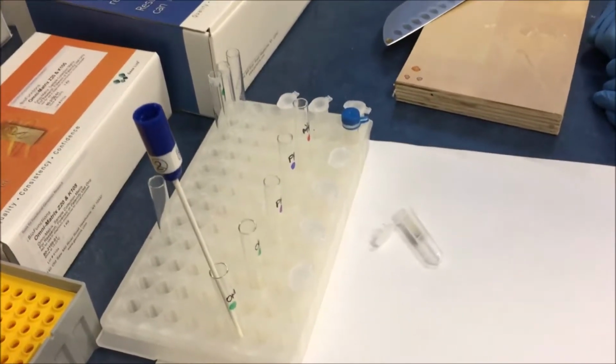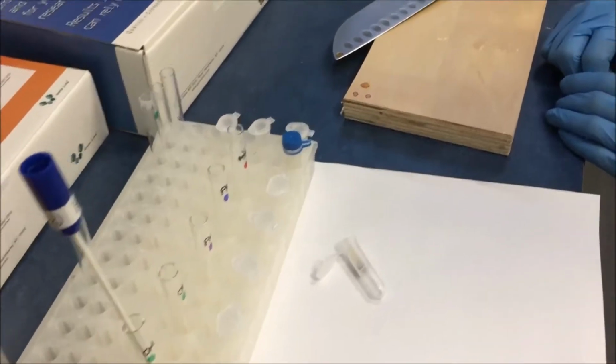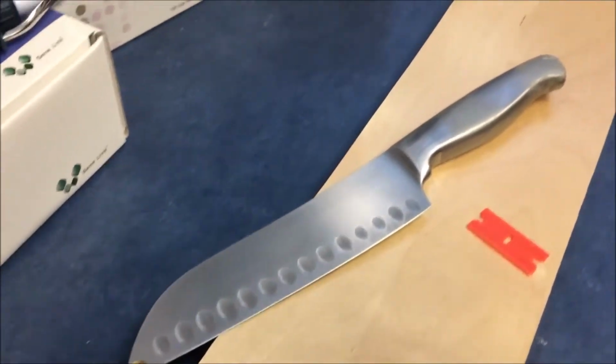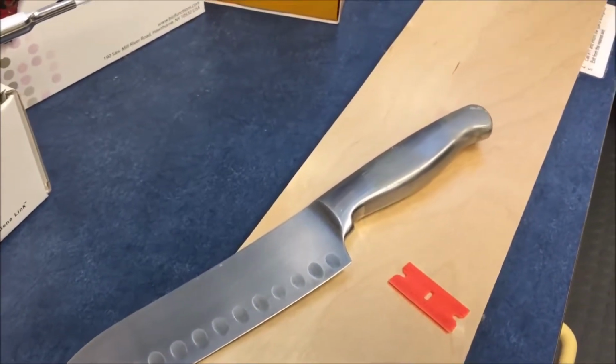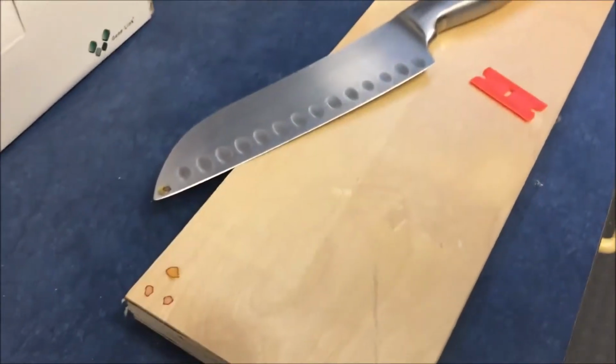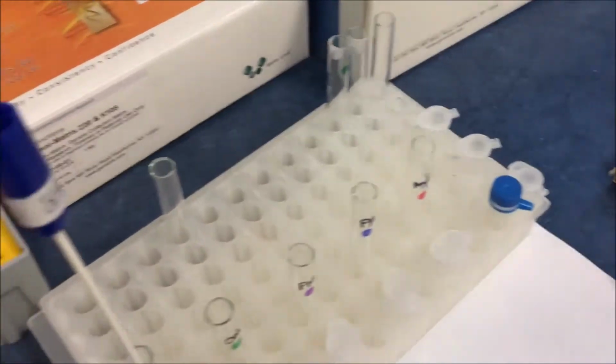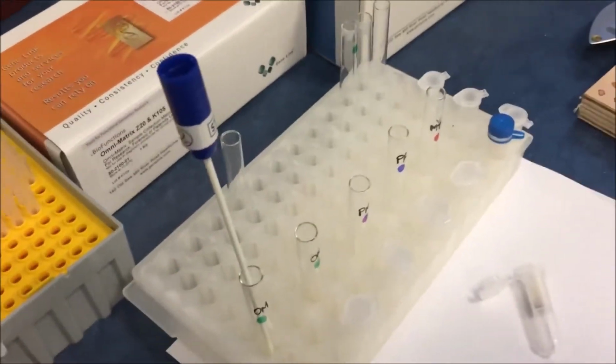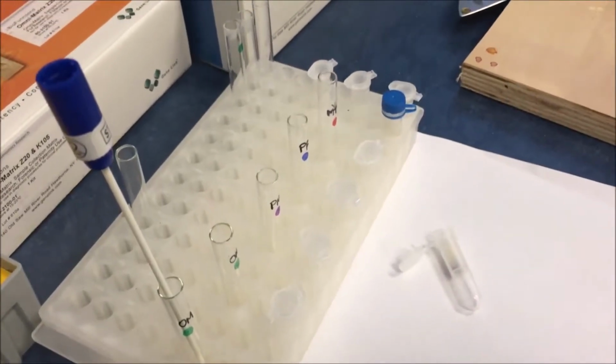Thus there is 100% recovery of the sample, whether it was collected from a knife using trace DNA sampling, or from wood, or any other sample collection method. Whatever is collected is 100% soluble in the lysis buffer.